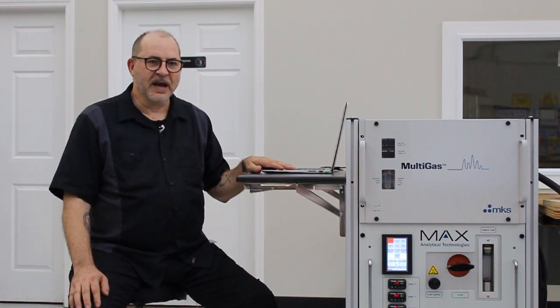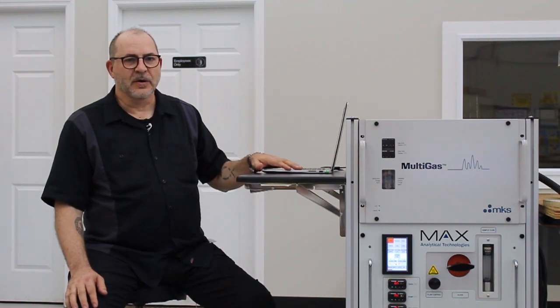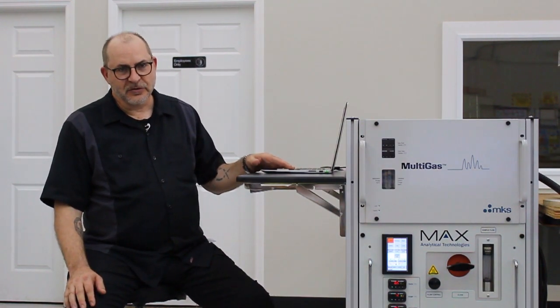Today we're talking about validation spiking with FTIR stack testing. It's a key factor in having a robust data set, or if you will, valid data. So I'll give you an overview, but it's up to you to read the methods and follow the requirements. The basis of the spiking is methods 320 and 301. Methods 321 and ASTM D6348 accomplish similar ends as well.